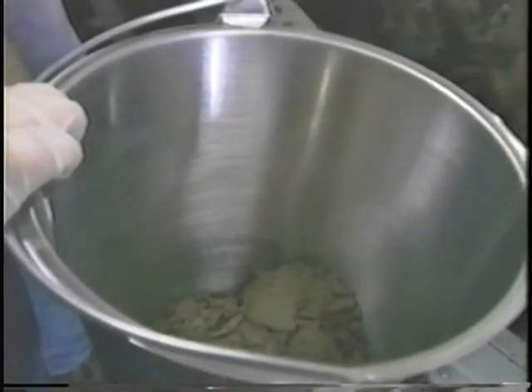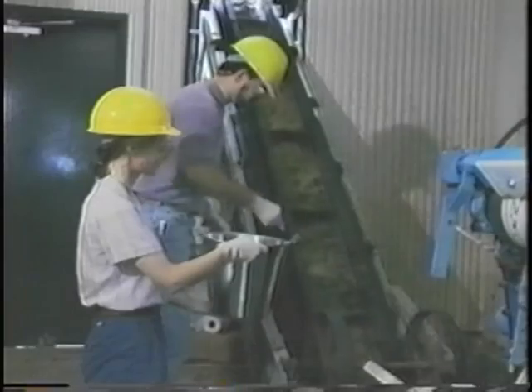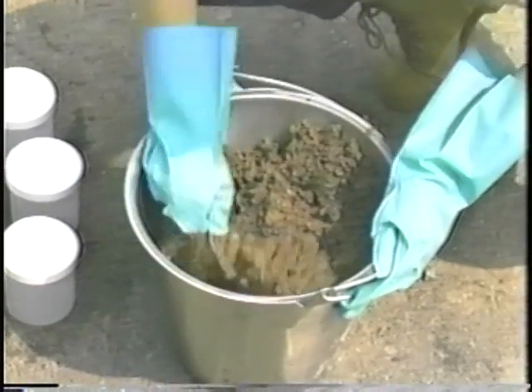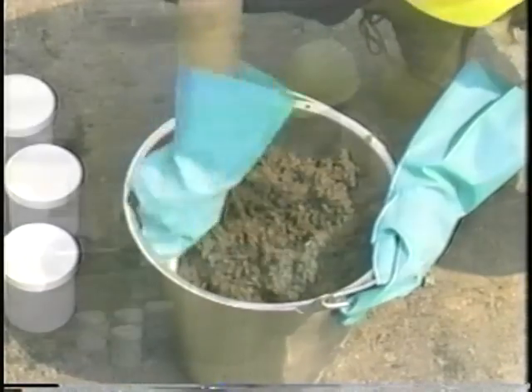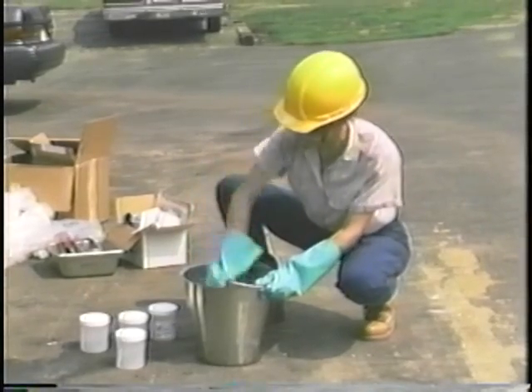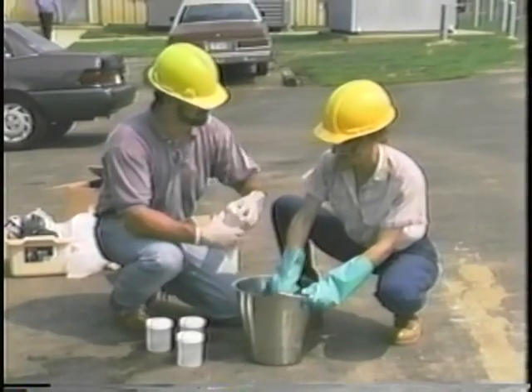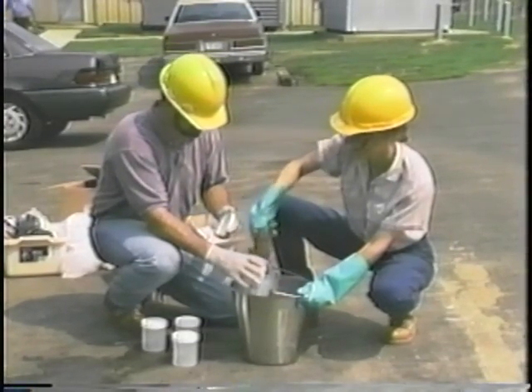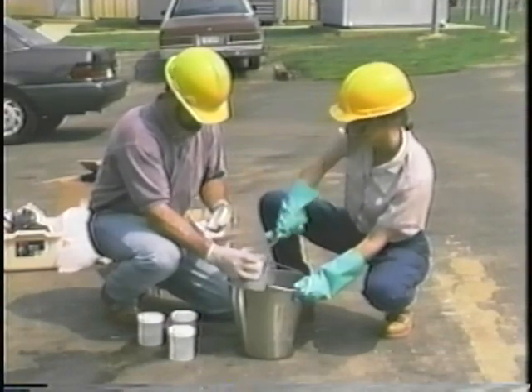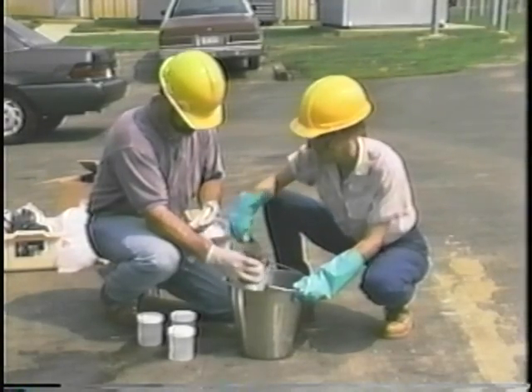To collect a composite sample from a conveyor, take a series of aliquots over the entire discharge period and mix them in a bin or bucket. Keep the samples on ice until you're ready to fill the containers. Mix the sludge thoroughly, stirring and folding for several minutes. Next, fill the sample containers. Biological activity causing gas formation is less likely in dewatered or dried sludge, so leaving room for gas expansion within the sample container is less critical.